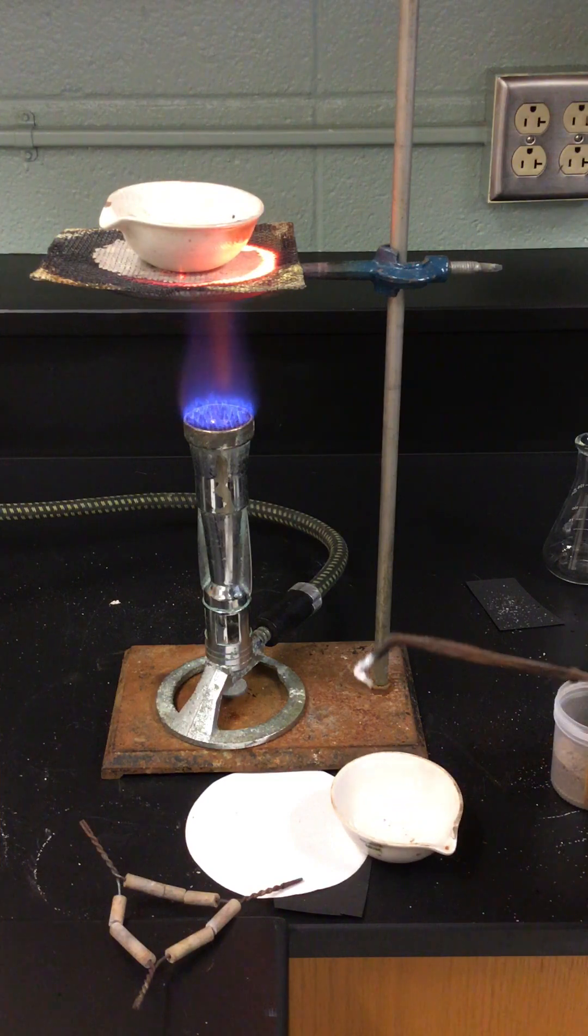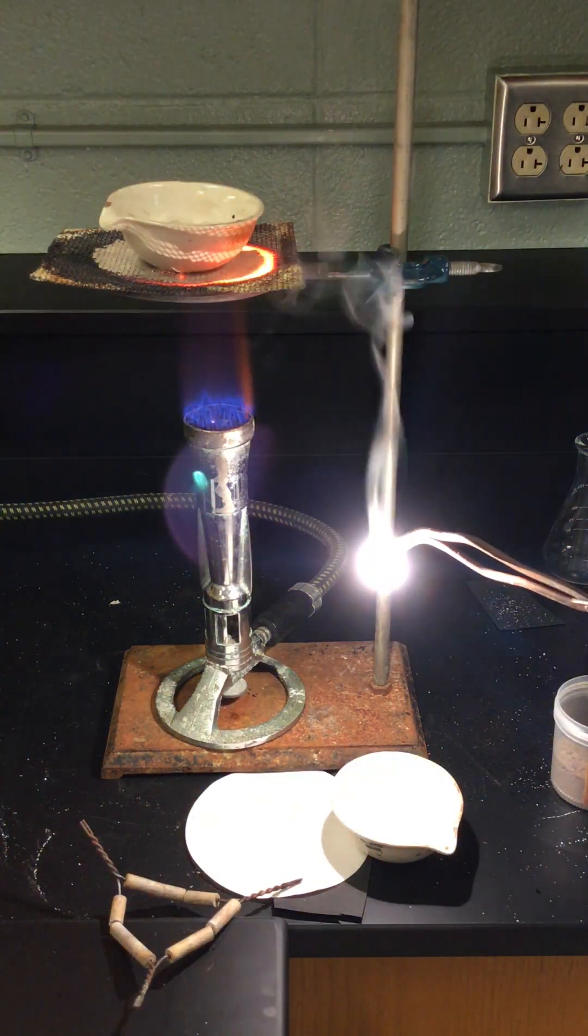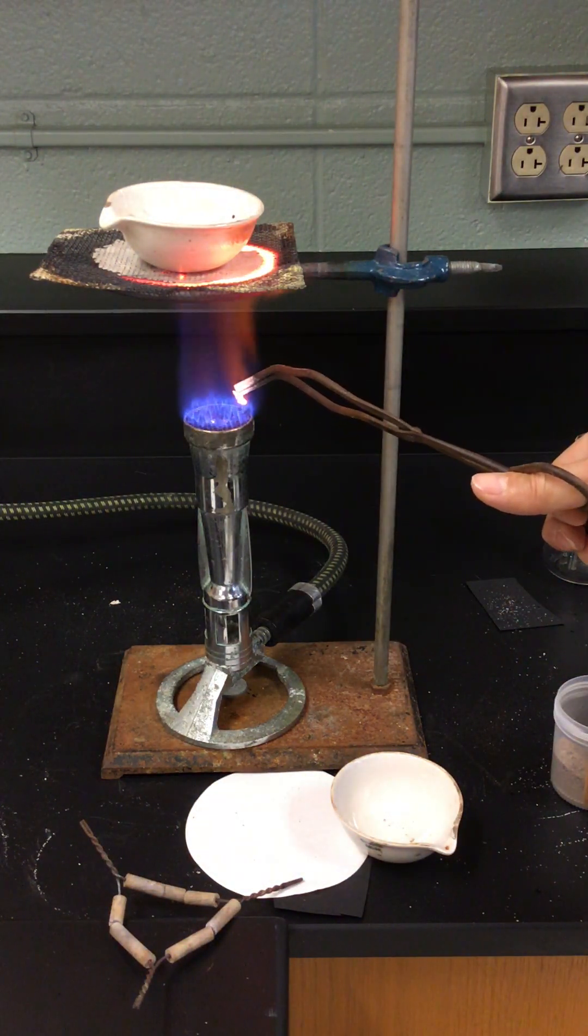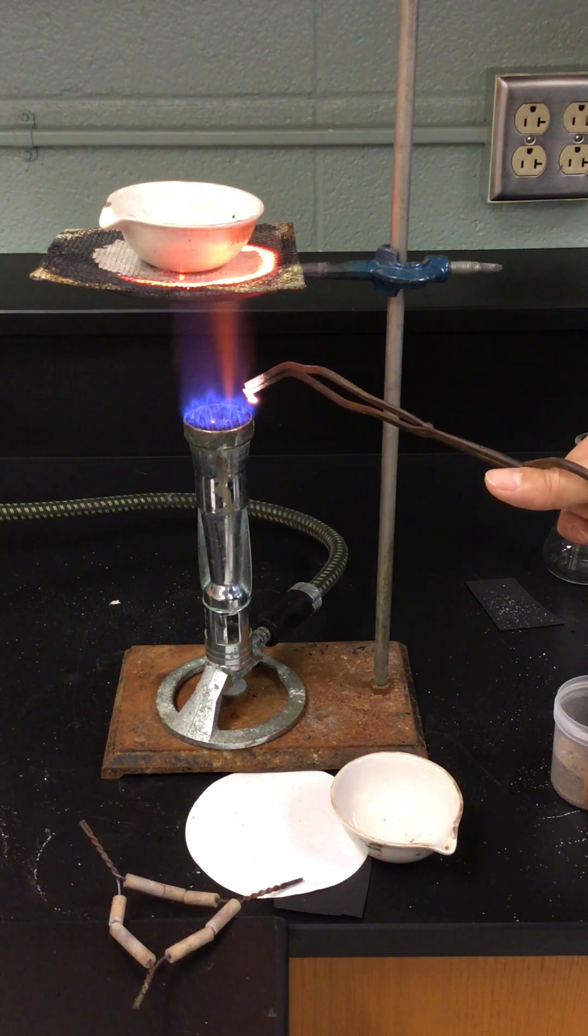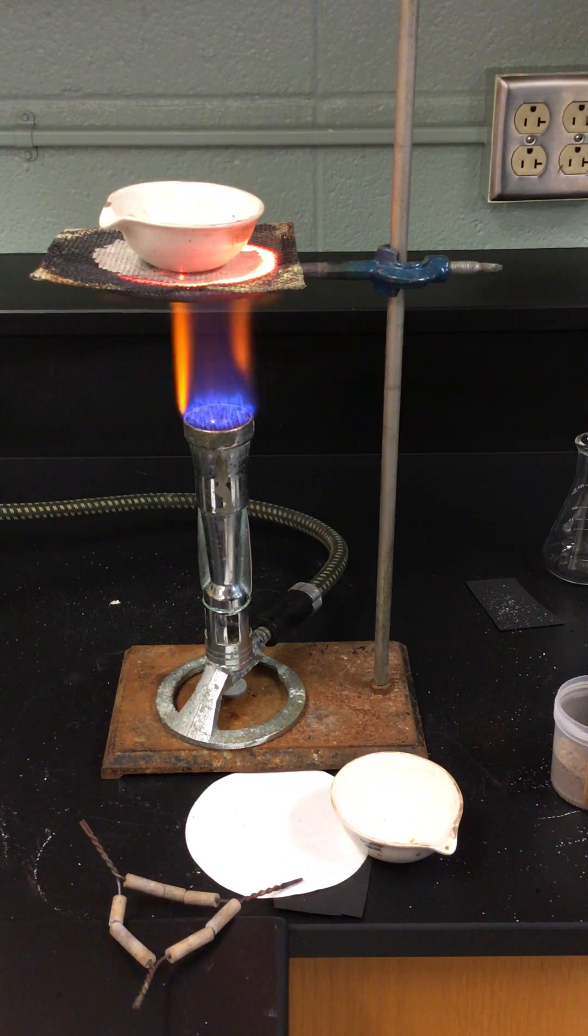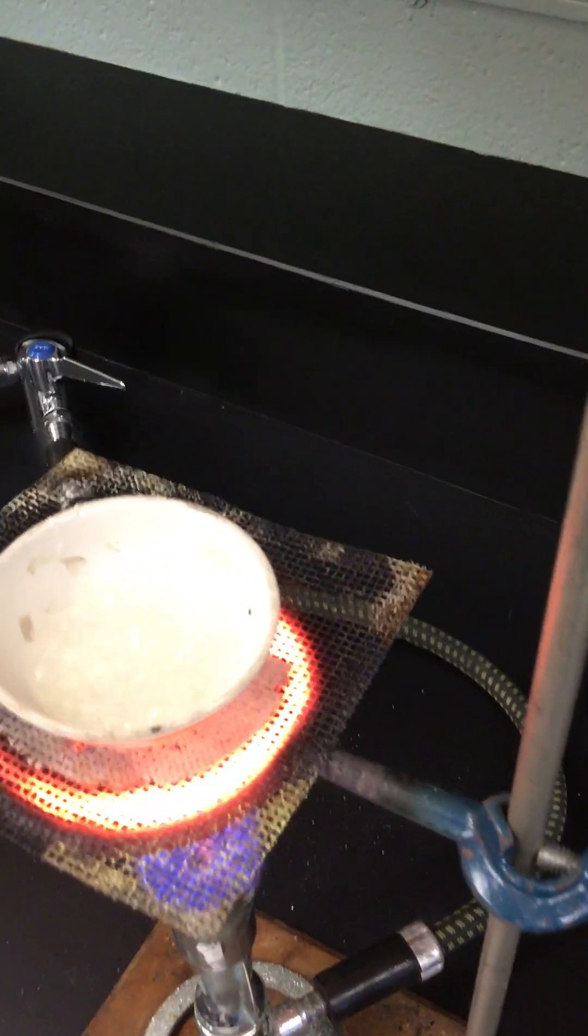That had a bunch that didn't burn, so we have a part where we're going to burn the combustion product. There, very nice. I'm going to see if I can carefully move my iPad to show you what's happening inside here.